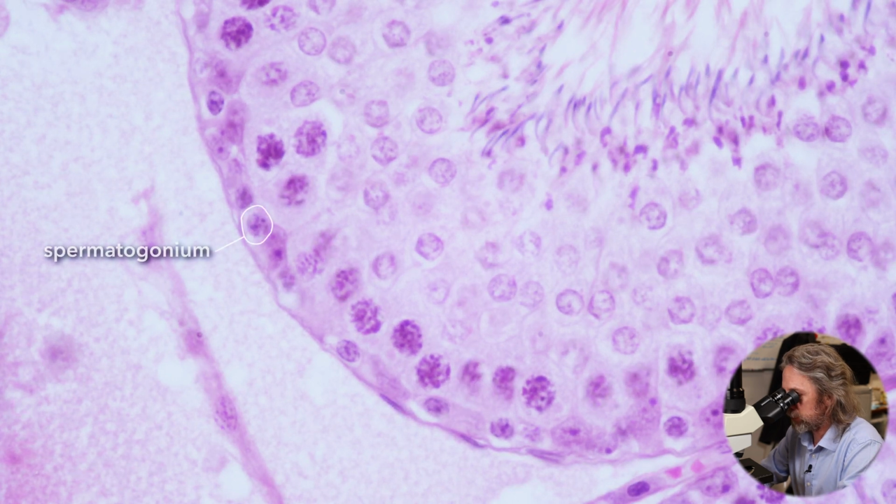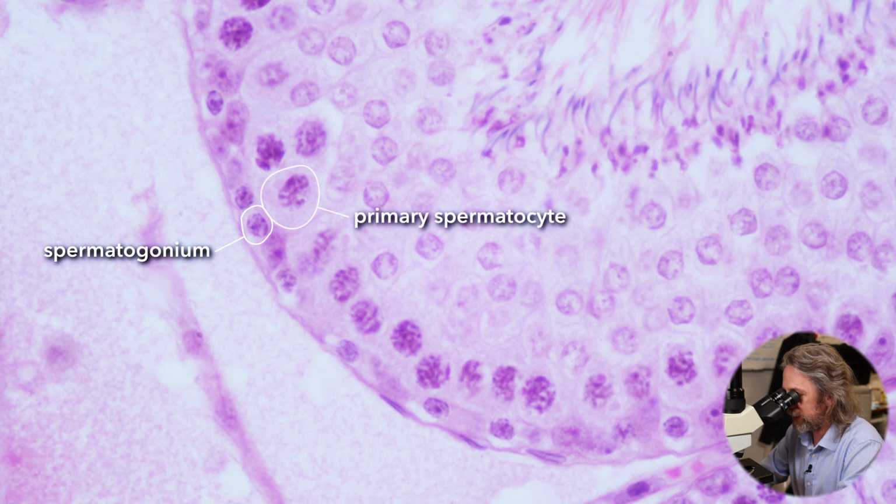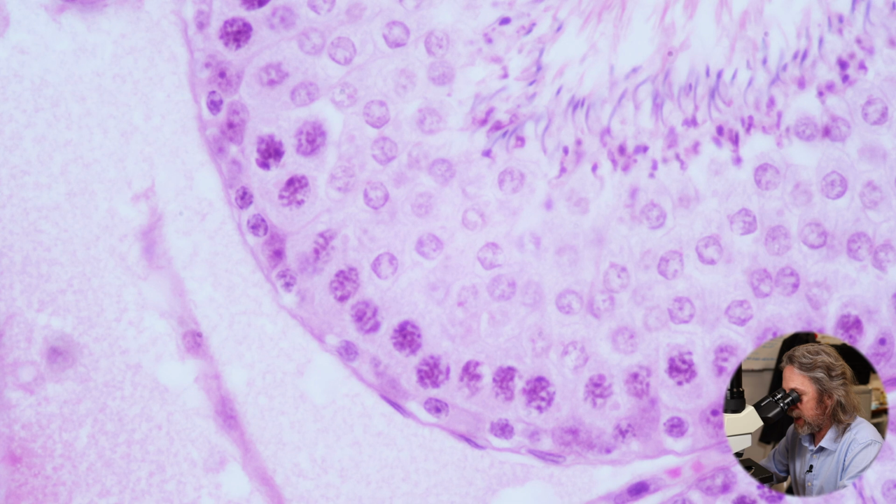So if you look at the spermatogonium and then we move to the next layer of cells, the primary spermatocyte cells, how do they look different? Well, if we look at the dark purple stain, we're just looking at the DNA, the nuclear material. But the cell is bigger than that. We can see the edges of some of the cells there, so we can see the cytoplasm of the primary spermatocyte. But if you look at the purple, the DNA of the primary spermatocyte, what do you think? Is there more DNA in the primary spermatocyte than in the spermatogonium? Yes, there is. Well, how has that come about?